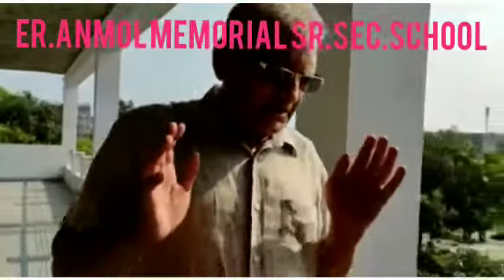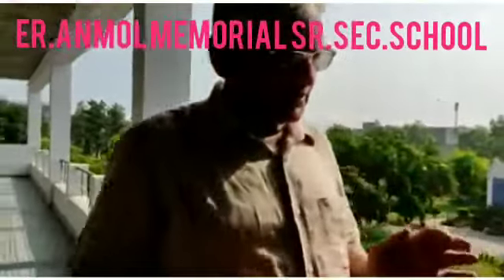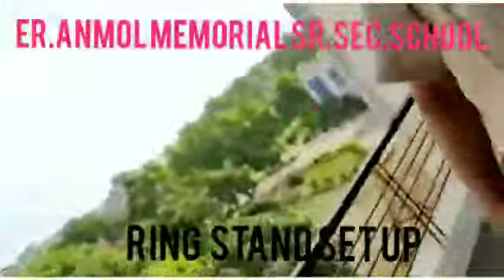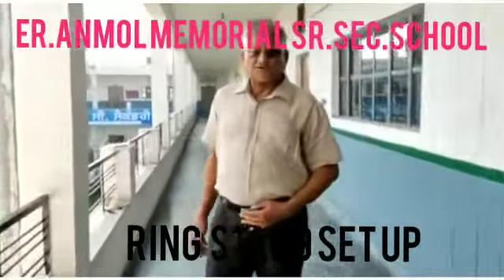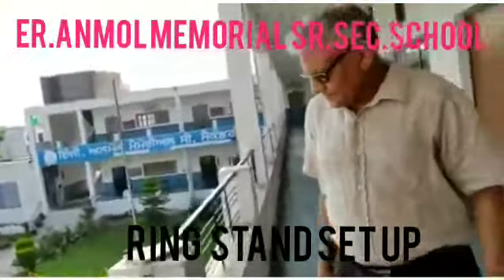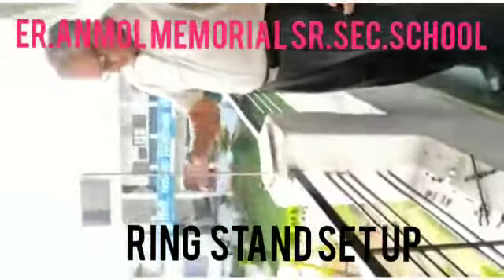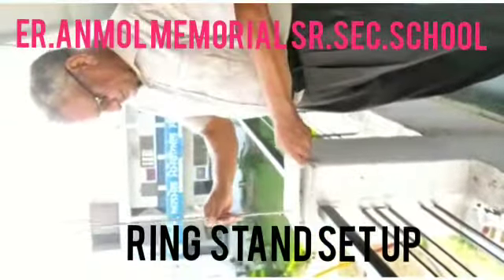I am out of the laboratory and I am going to show you a video — look at it carefully. This is a rod. The rod has been fixed in the stand. This is the base.